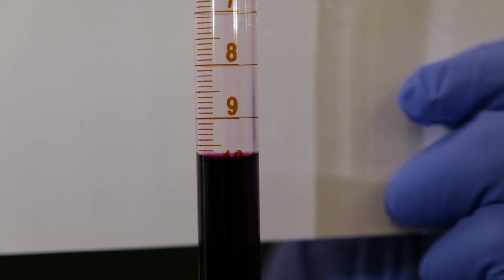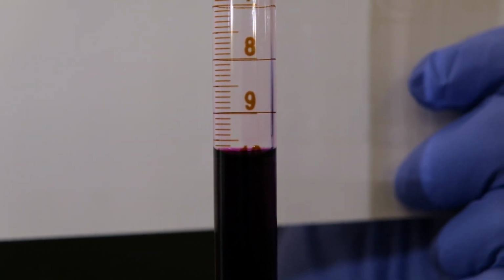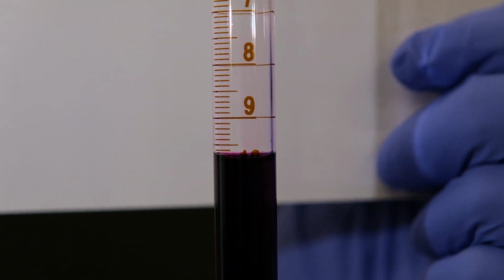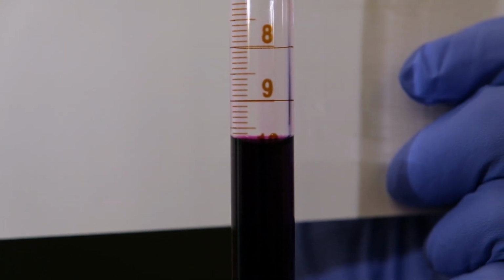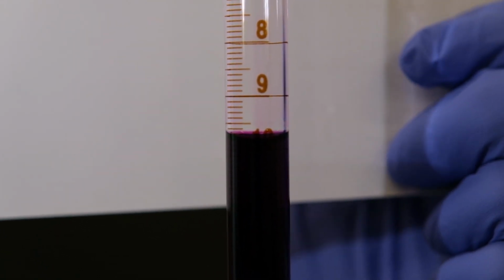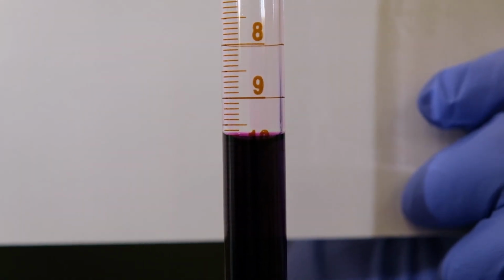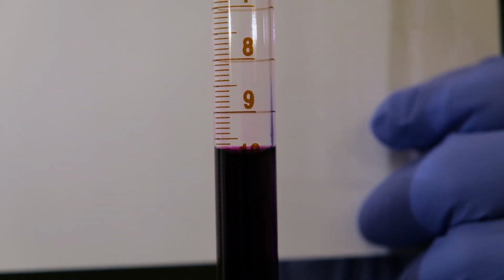If you're done reading the third titration, compare the data you collected. If the first 3 significant figures of the total 4 that you need to record are the same, then you don't need to do any more titration. You can just stop at 3. If that wasn't good enough, then you do a 4th one.